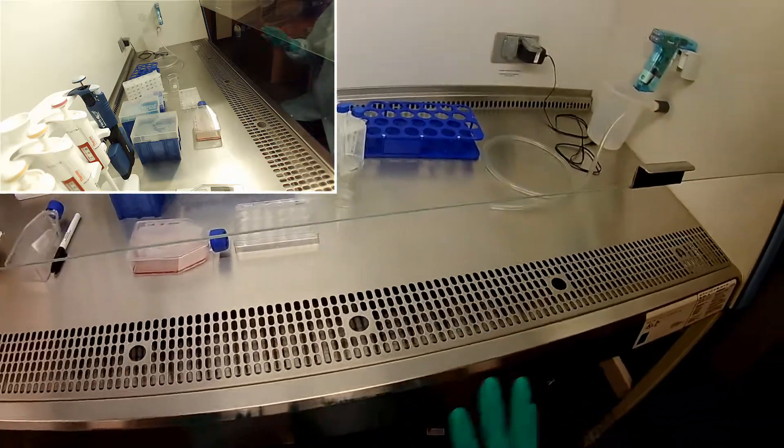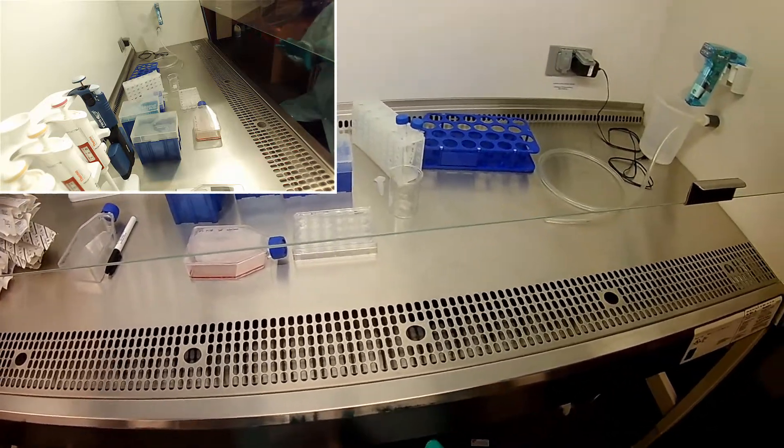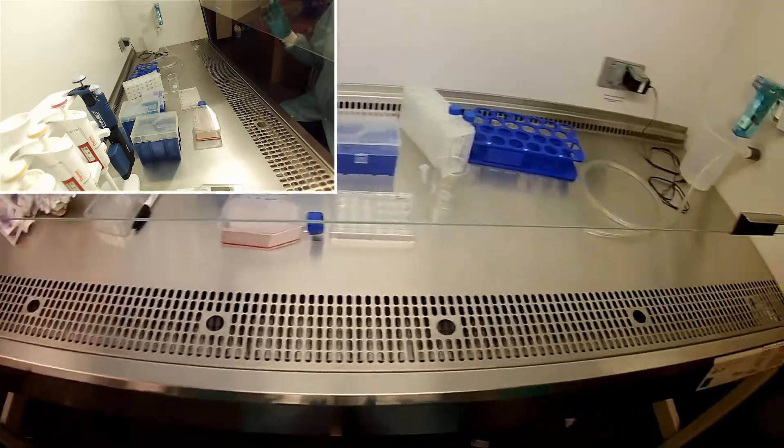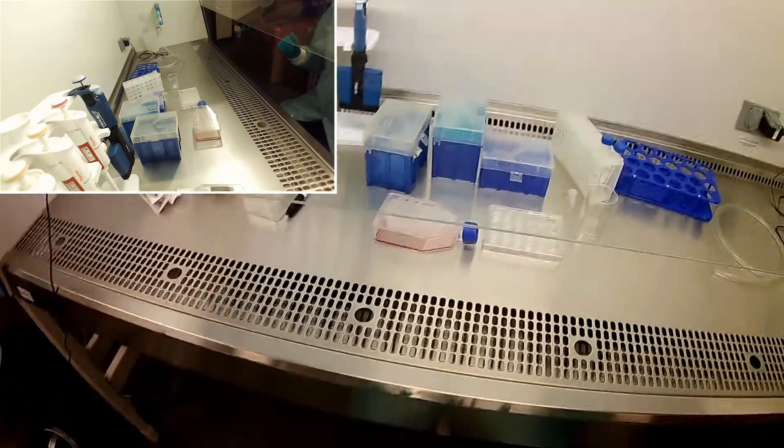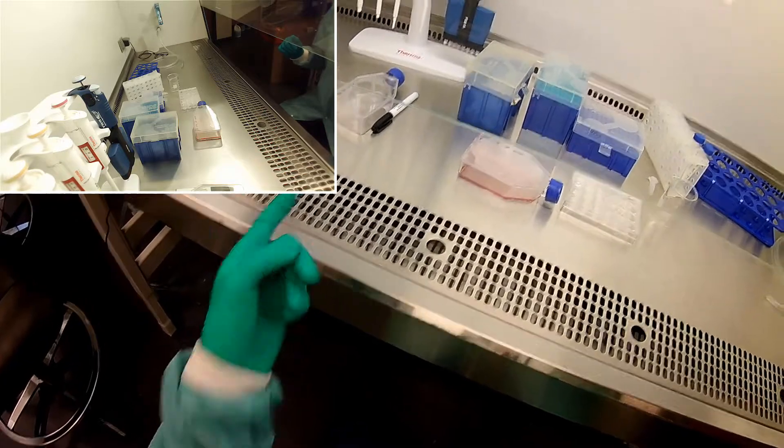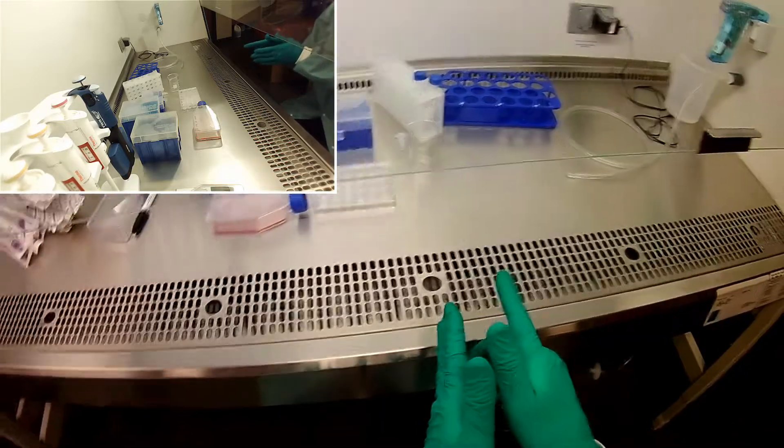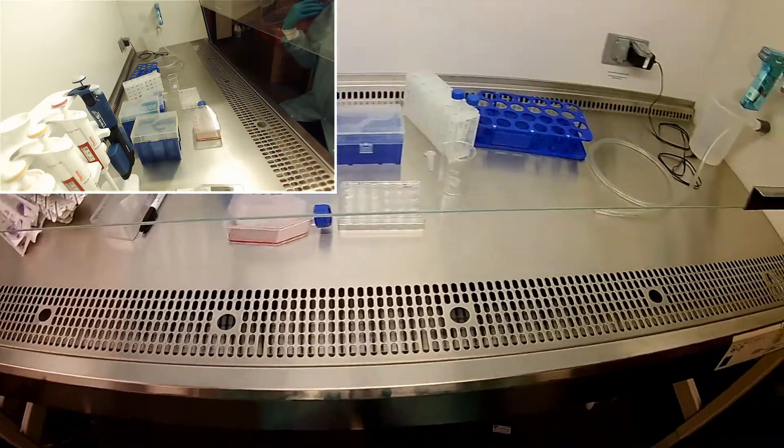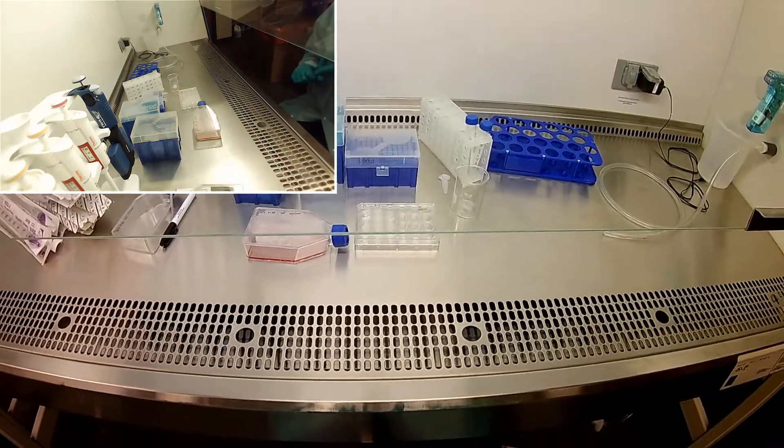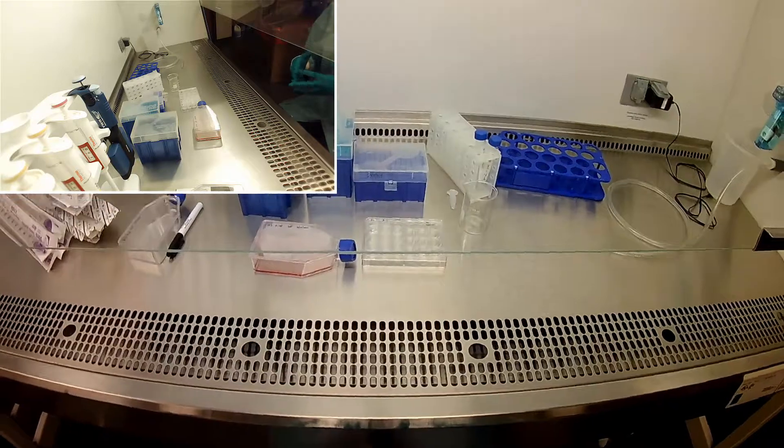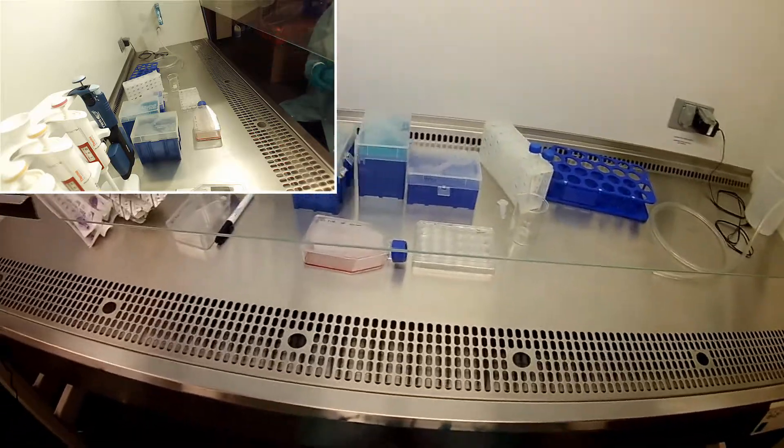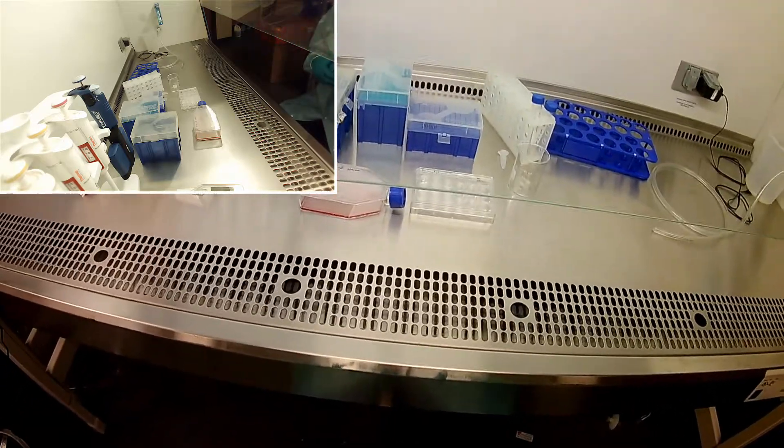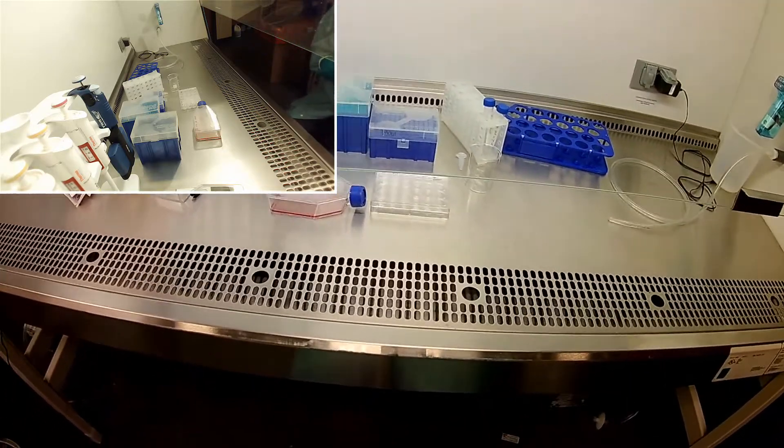I've already prepped everything out pretty well, and this is something you would also do as you're planning your experiment. I've already written labels for the new flask and labeled my 15 mil tubes while waiting for my trypsin to thaw and my media to heat up. We're just getting ready so that we don't have a lot of waiting around doing nothing. Now everything is ready, so let's go ahead and start the experiment.